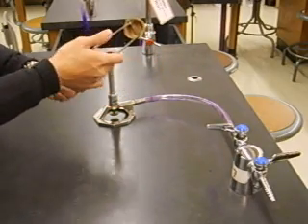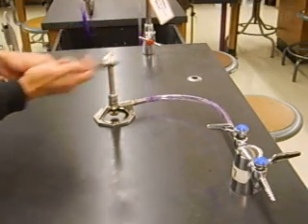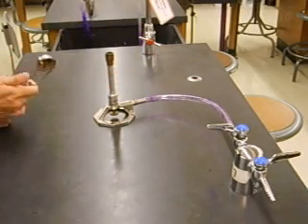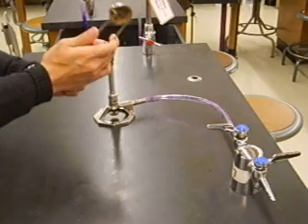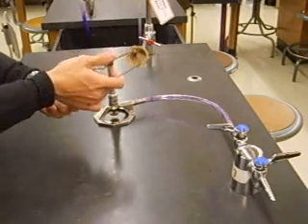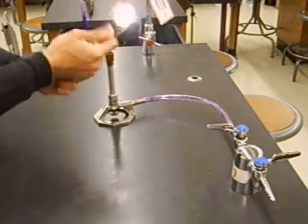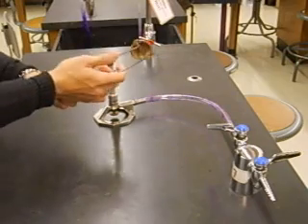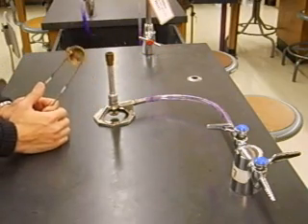So practice making sparks with the striker first before you actually use the striker to light the Bunsen burner. Once you're okay with making a spark with the striker, now you can light the Bunsen burner.